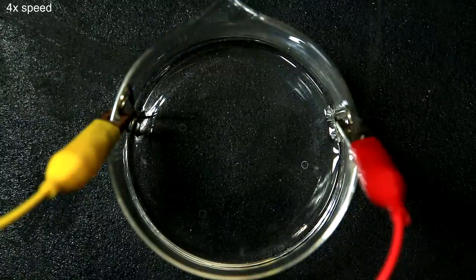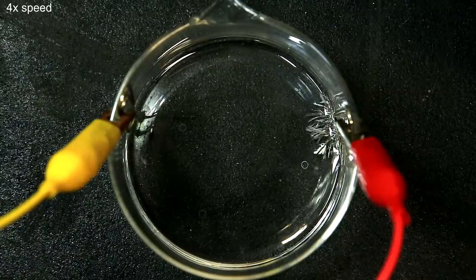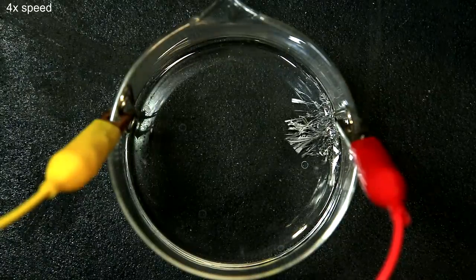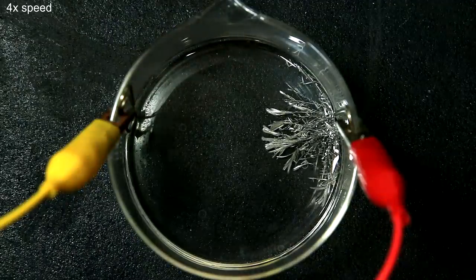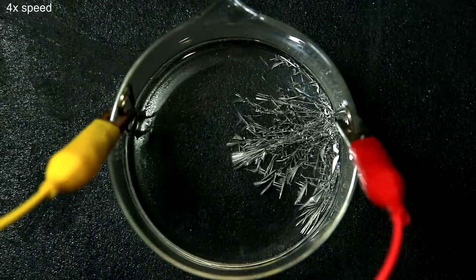I opted to redo the experiment with better lighting and indoors and the result was much nicer. The crystals grew very nicely and I was quite satisfied with the result.